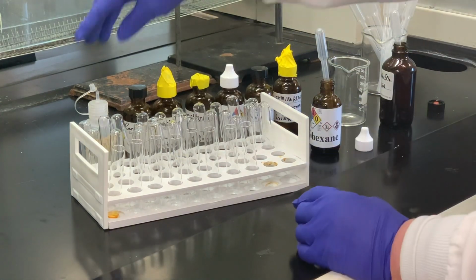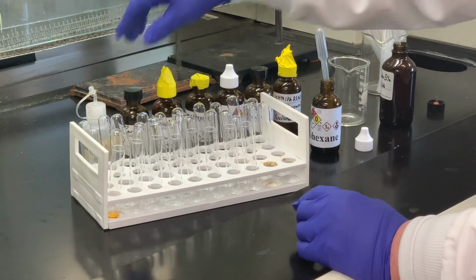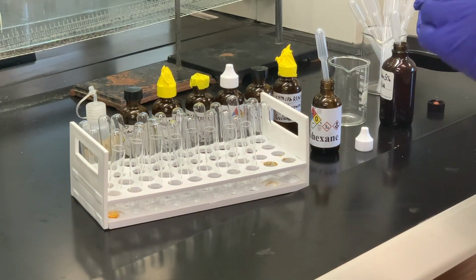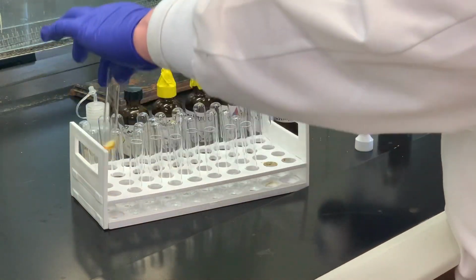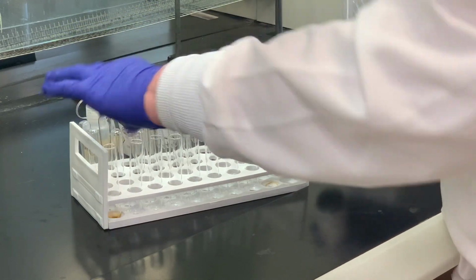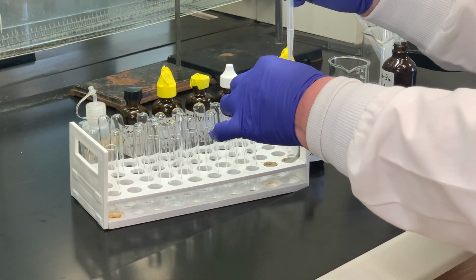The next compound I'm going to try is mineral oil, and the one after that is canola oil. And those substances are fairly thick, so I'm going to dissolve those a little bit in cyclohexane. Why cyclohexane? I know it's not reacting with the bromine, so it will not give me a false positive test. So I'm going to add a little bit of cyclohexane first to the second and third test tube.